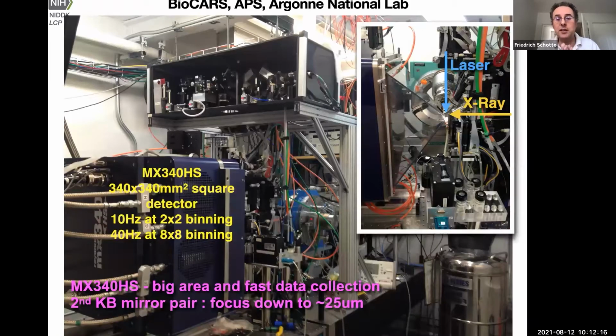And this is how it looks in the experimental hutch. So we have a lot of equipment in a very small hutch. The first thing you see, of course, is this big X-ray detector. And then, very important, a high-speed chopper to isolate single pulses. And here, if you see from the side, is where the sample actually is. So the sample is in a capillary, on a translation stage. The laser hits it from here. The laser is focused down here.